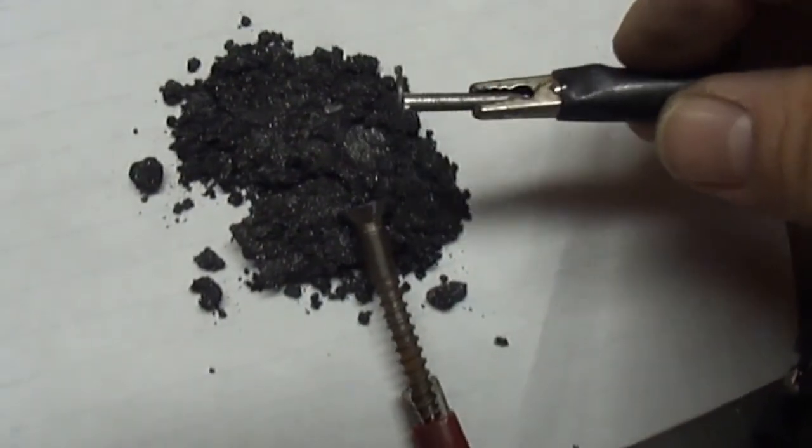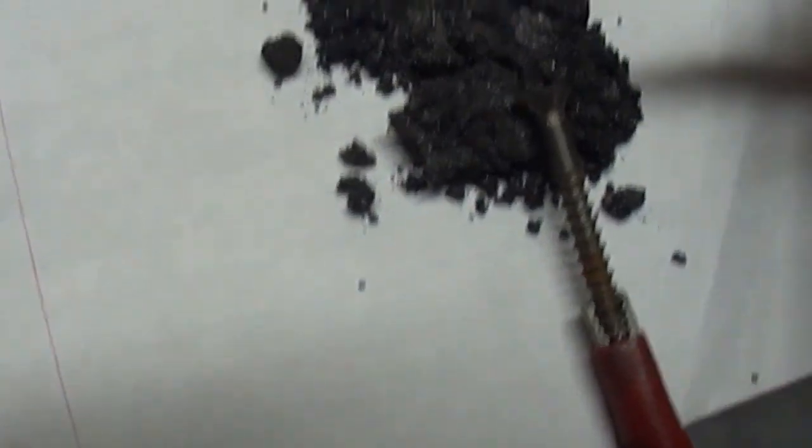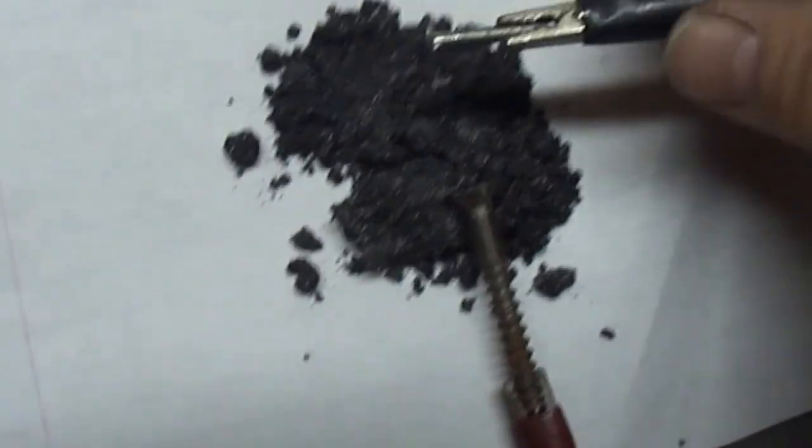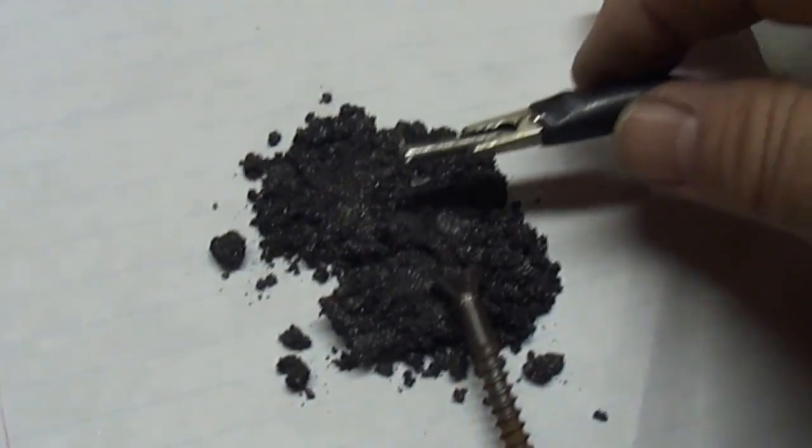We're going to take a resistance reading on it. I have a positive electrode just laying on it. I'm going to just lay the negative electrode on the powder and we'll see what happens.